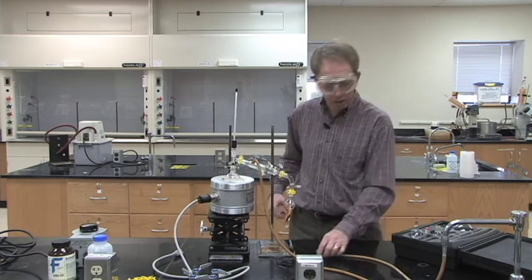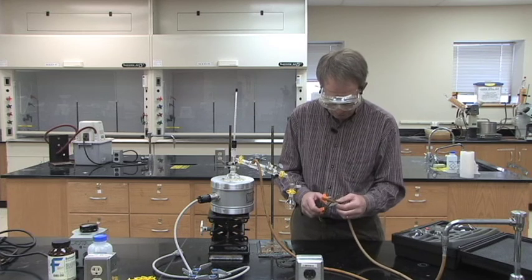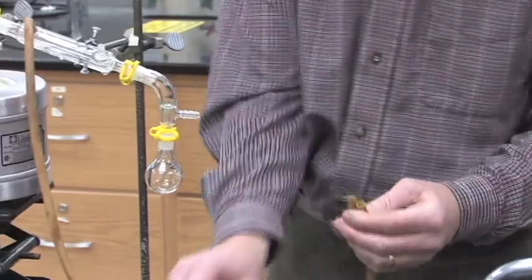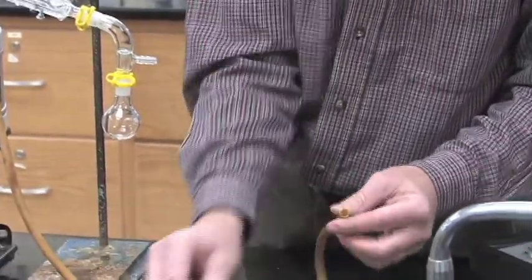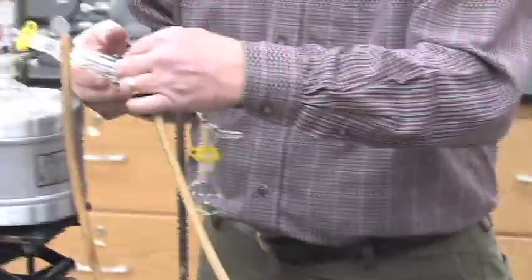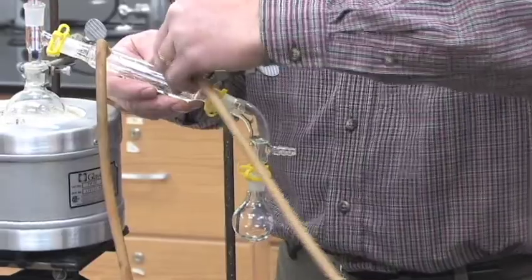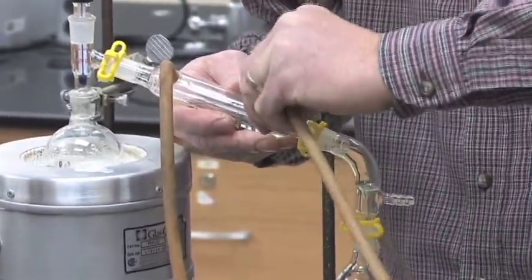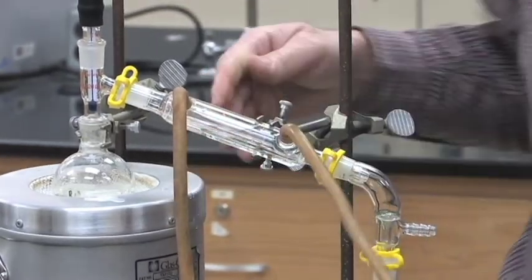I've got a hole in my hose. Okay, with the hole in the hose, what I need to do is snip off just the tip of the hose to make sure we get rid of the hole in the hose. And there are holes in some of the hoses. You want to be careful that you don't cut too far down on the hose because it will make the hose too short. But put the hose back on the condenser. And I'll get a paper towel and clean up my water spill.